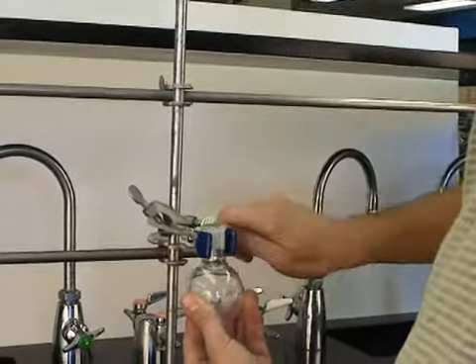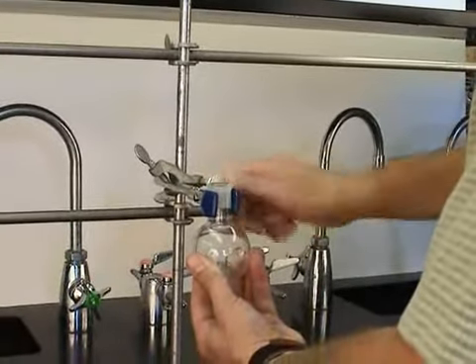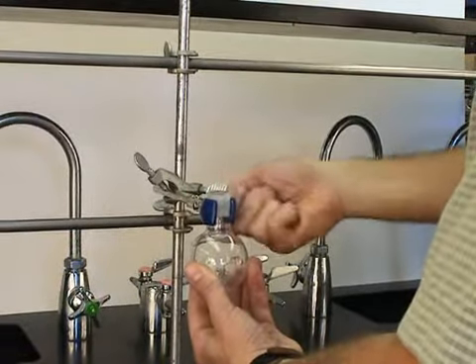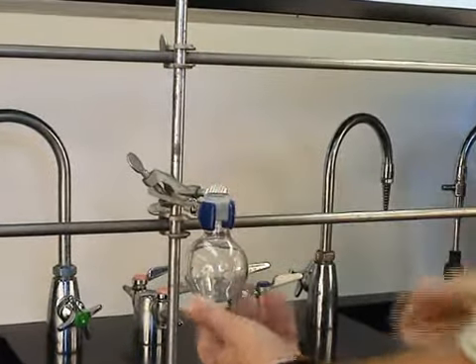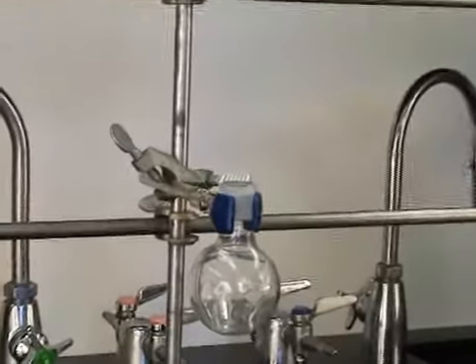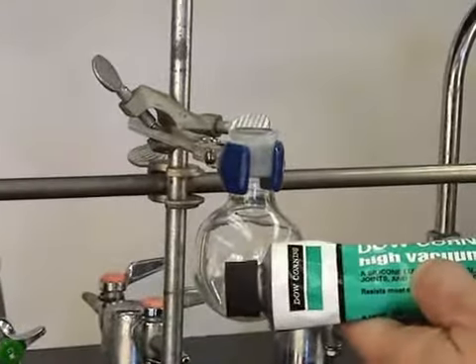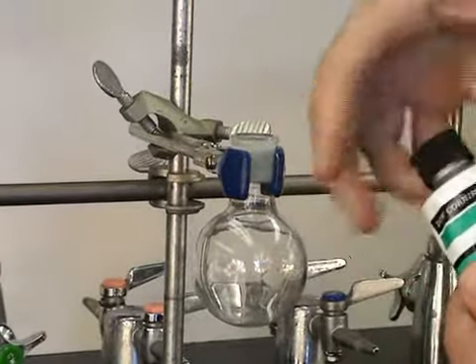Next, we clamp the distillation flask. Make sure it's far enough off the bench to allow for a thermal well and a jack. Make sure that it's vertical so that when we attach the other pieces of glassware it works properly.